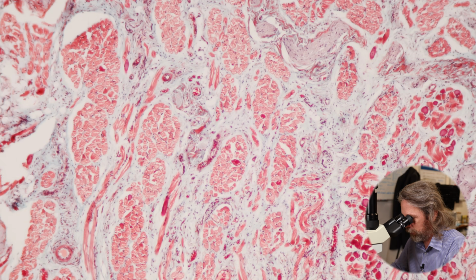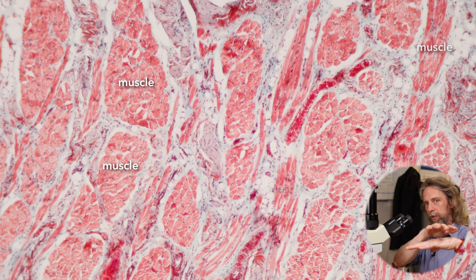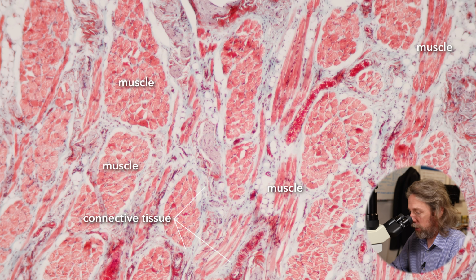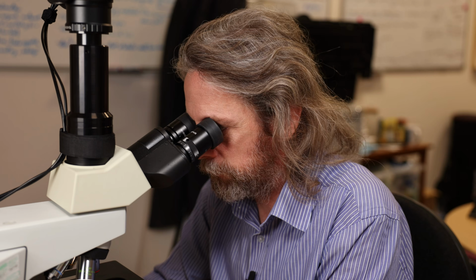And as we go deeper in here, now we're looking at blocks of muscle. So we've got some muscle fibres running in one direction, some muscle fibres running in the other direction. So we're seeing lots of red, and that's all skeletal muscle. And we're seeing lots of green, that's the connective tissue binding it all together, and in there we'll find blood vessels and nerves and what have you.